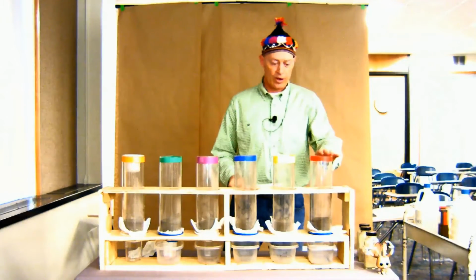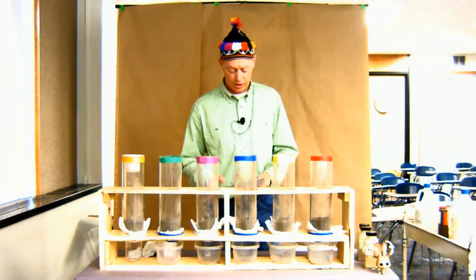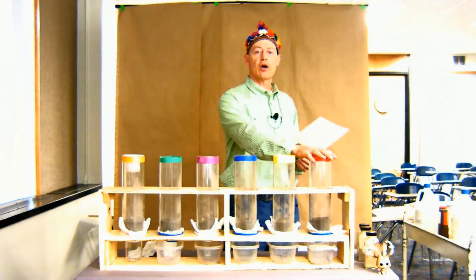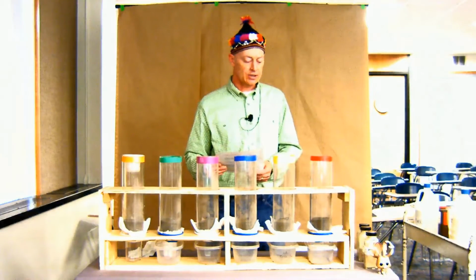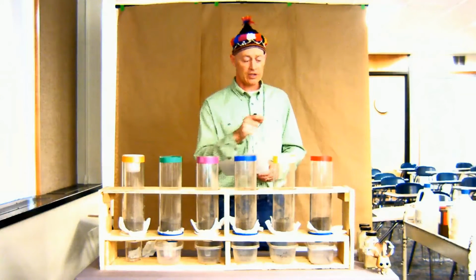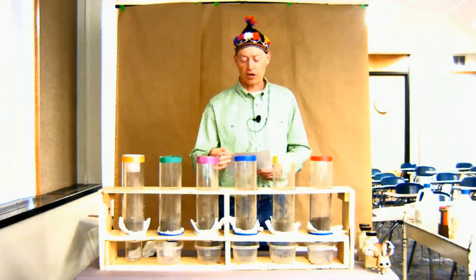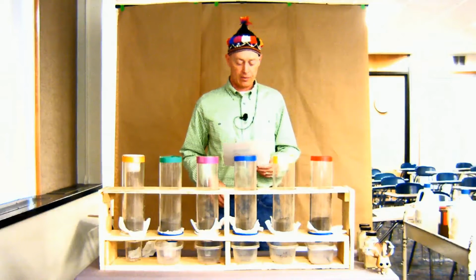So the last one, the red one, is a non-sodic sandy soil that has low electrical conductivity. This is a soil from Oakes. So it's about 70% sand, and so it's a very, very coarse textured soil. But what we're going to do is make this into a sodic soil. We're going to make this behave just like the high SAR, low EC, the orange one. But it's going to take a little bit of manipulation on our part.